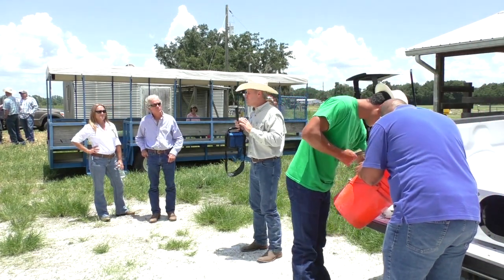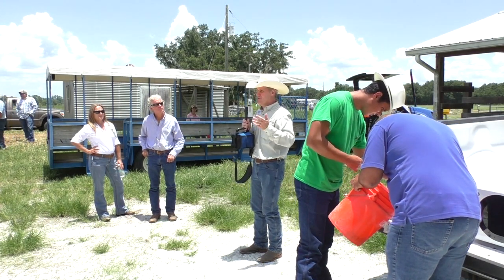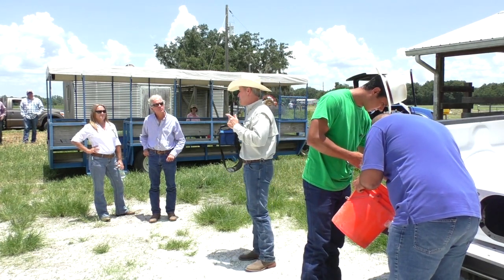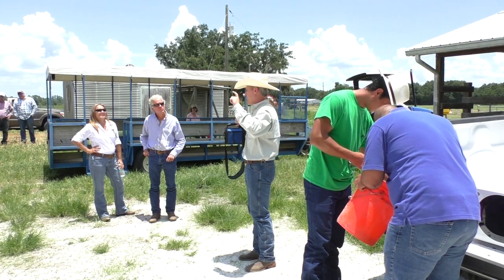The first thing I mentioned: if you use the microwave inside your house or in any circumstances, you need to put a little cup with water inside the microwave, on the corner.